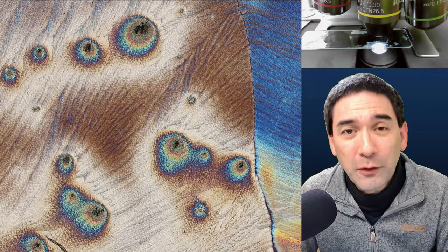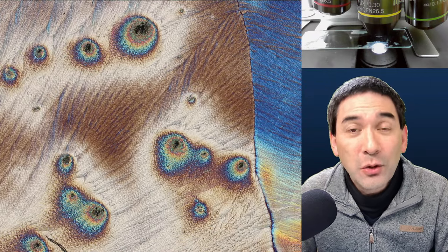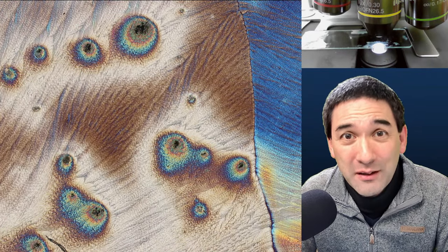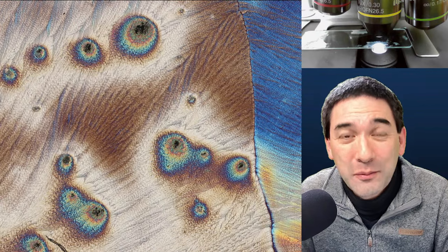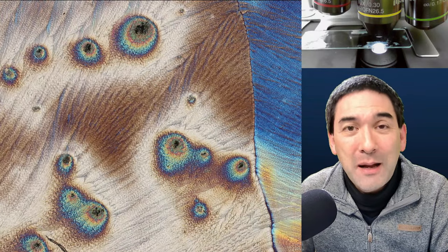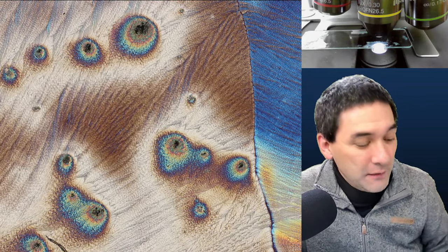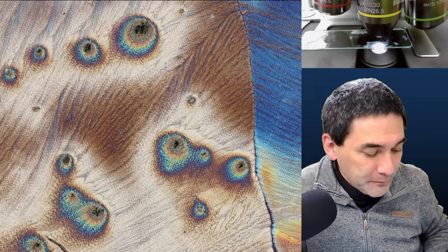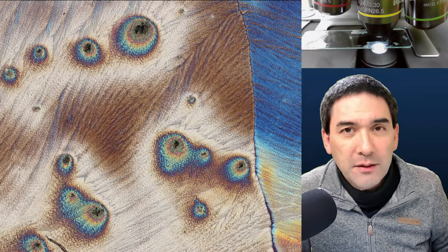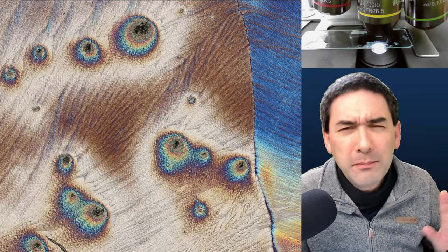Today I'm going to complete something I started last week — I forgot to show you the vitamin C slide. Last week I prepared some crystals, and at the end of the stream someone reminded me to put vitamin C under the microscope. I'm also going to put a water plant under the microscope to see the chloroplasts moving, answer nine microscopy-related viewer questions, and share some videos and pictures sent to me.